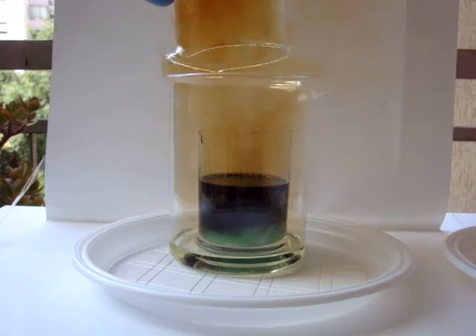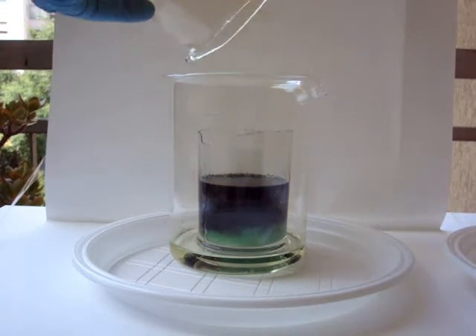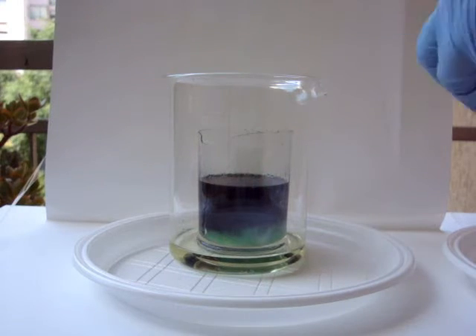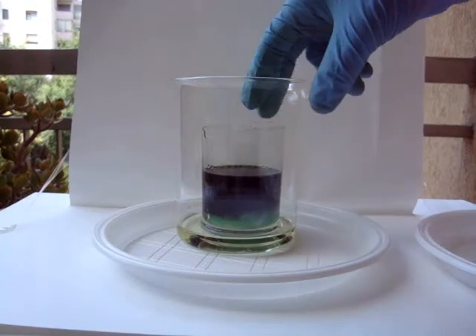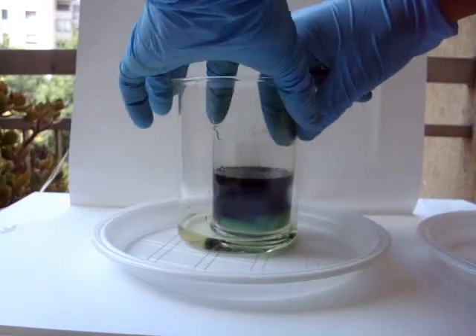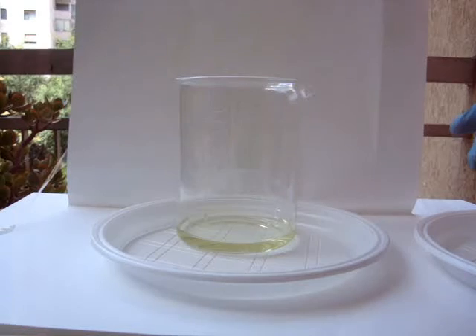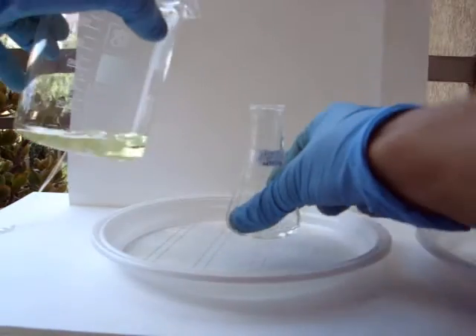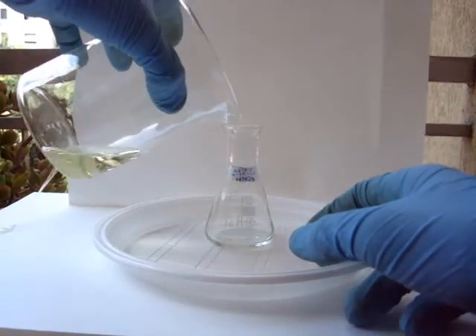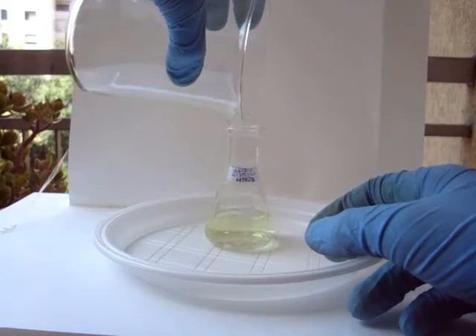This process is not very efficient but it works. The inner containers are already cloudy with gas, so be careful. Now pour out the acid. It is a pale green because it is contaminated with the original solution and is really weak but somewhat usable.